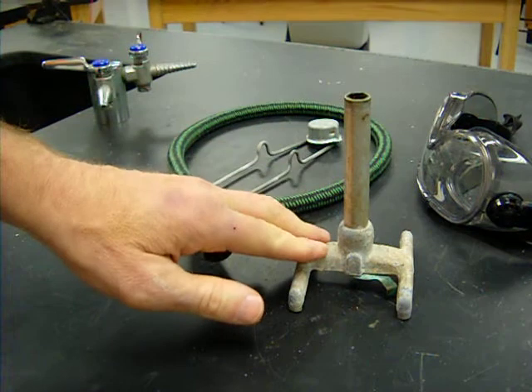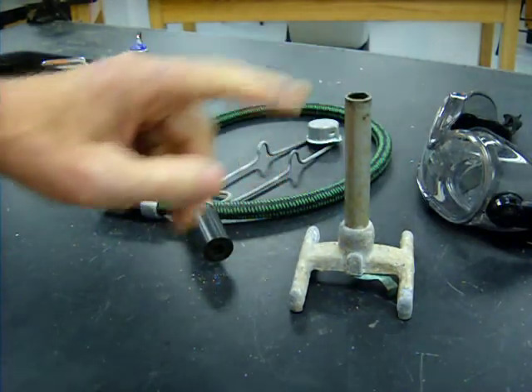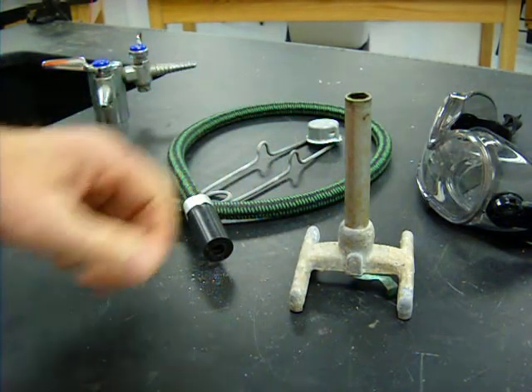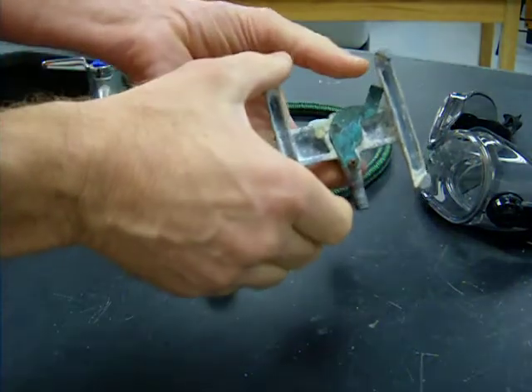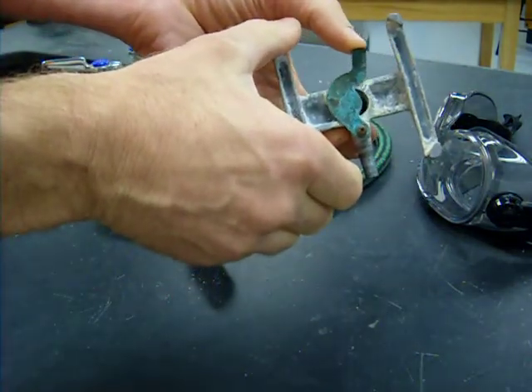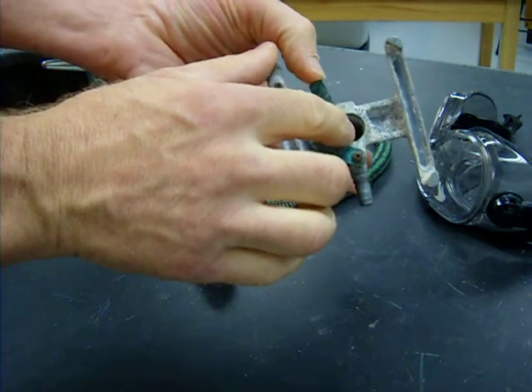Let's go over some Bunsen burner basics. I wanted to make a video specific for the type of Bunsen burner we're going to use in our laboratory. It's the simplest kind. It has one control on it.